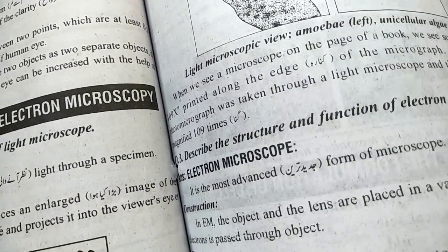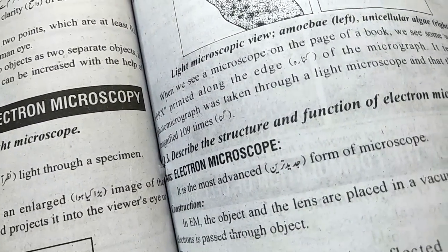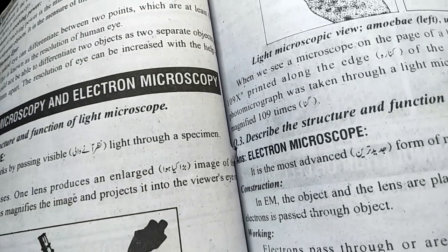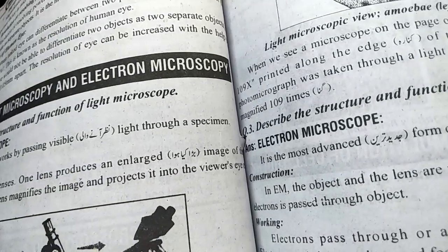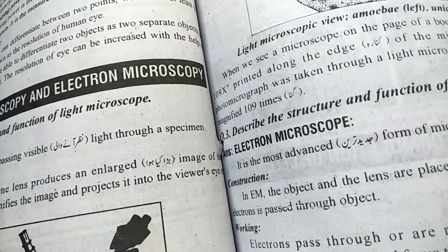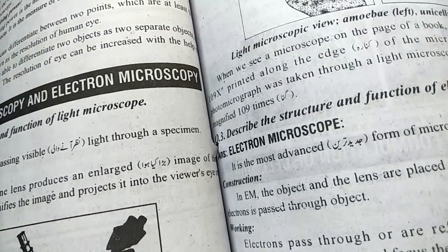It tells us that the image has been magnified 109 times. Describe the structure and functions of the electron microscope.